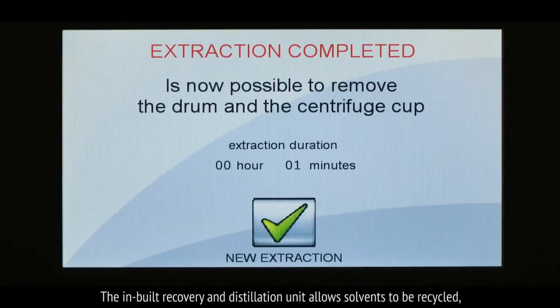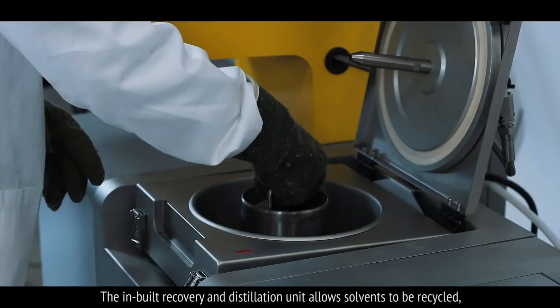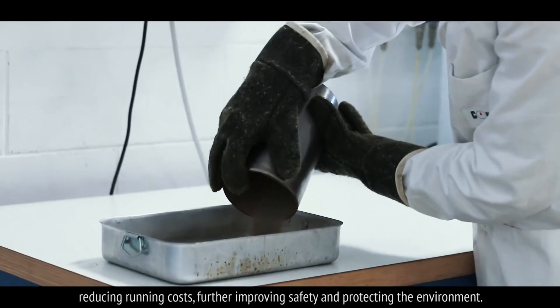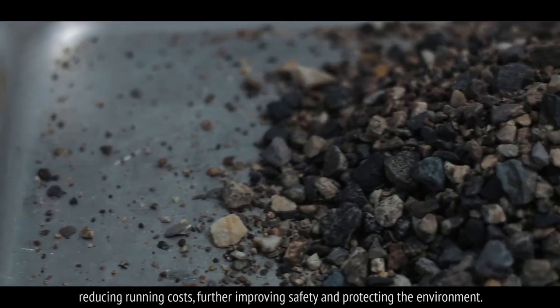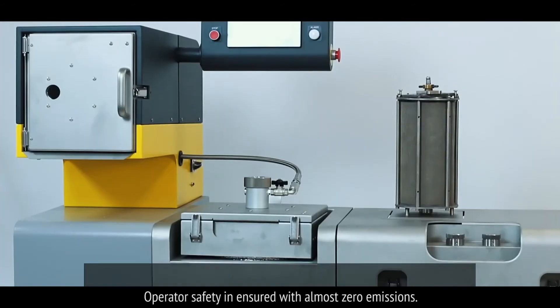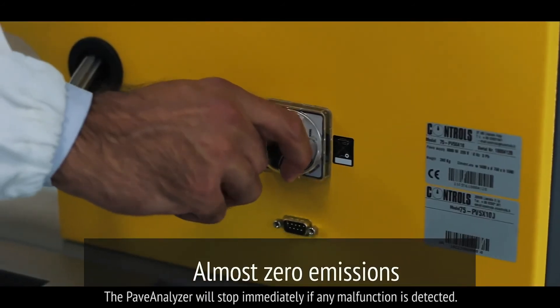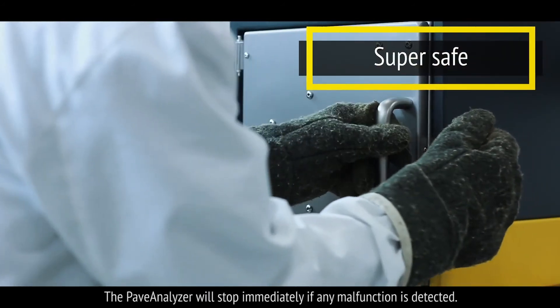The inbuilt recovery and distillation unit allows solvents to be recycled, reducing running costs, further improving safety and protecting the environment. Operator safety is ensured with almost zero emissions. The Pave Analyzer will stop immediately if any malfunction is detected.